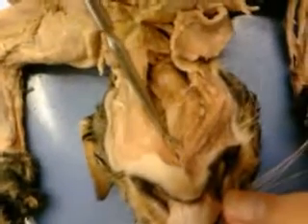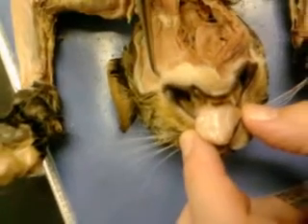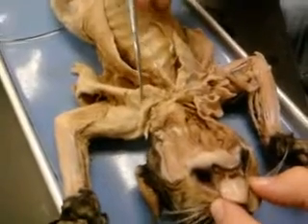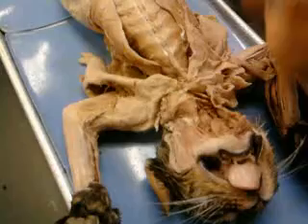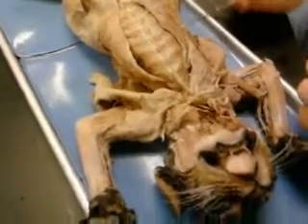Then we're going to move to the torso and neck. This is in the throat — on the sheet. We have the digastric, the mylohyoid, the sternohyoid, the sternothyroid, the sternomastoid, the masseter here, the pecto-antibrachialis — you can't really see it though. And then the pectoralis major, pectoralis minor, and the xiphihumeralis.